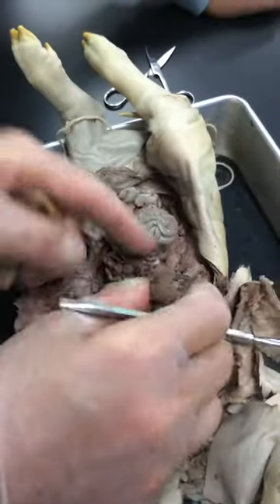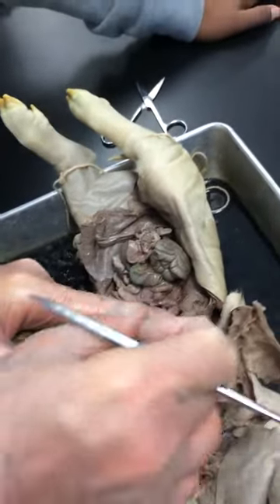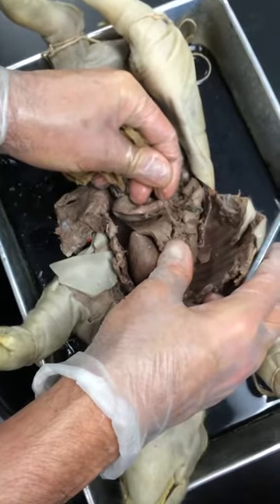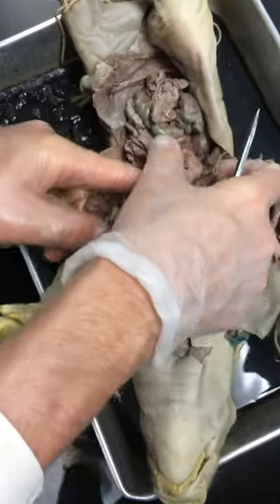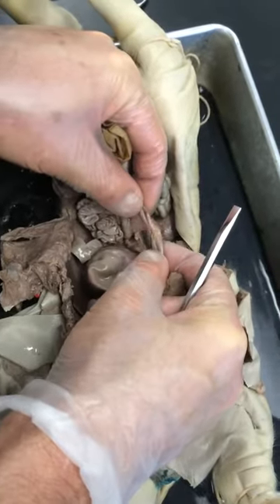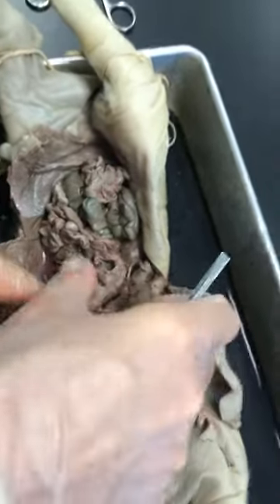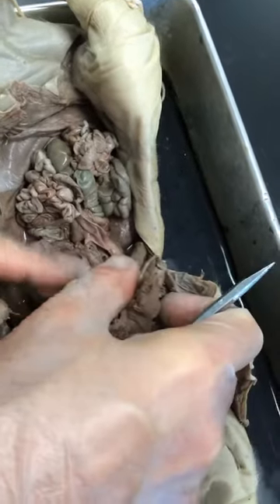Liver is this structure here, and notice it's posterior to the diaphragm. The gallbladder is this green sac-like structure right here — that's the gallbladder. The umbilical vein is going to shrivel up and becomes a ligamentum teres to support the liver. The pancreas is the glandular material under or next to the stomach — this stuff right in here. It lies between the duodenum of the small intestine on one side and the spleen on the other side. It's just glandular material right in here; this one's kind of torn up, but it's basically underneath the stomach.